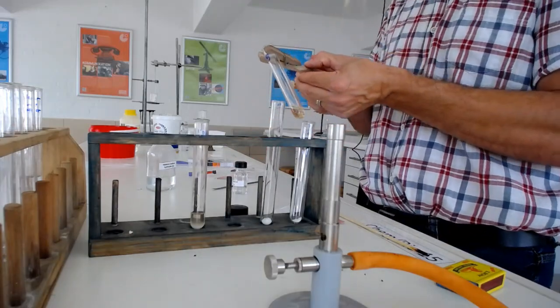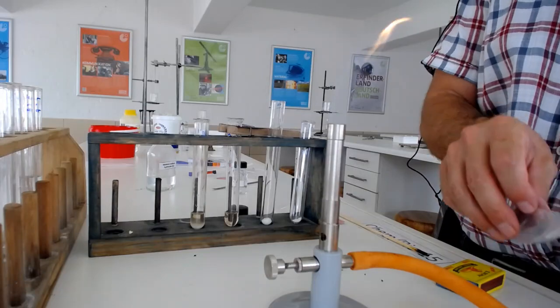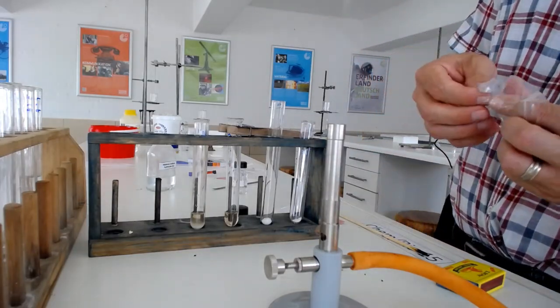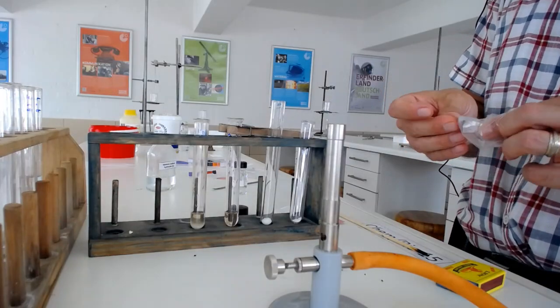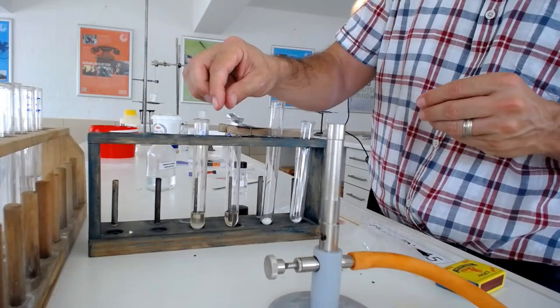Oh no, do you know what, I forgot something. There needs to be aluminium foil in there, that's why it's not working. So that's what happens if you don't add the right substance or you don't read your test or if you don't know your work.